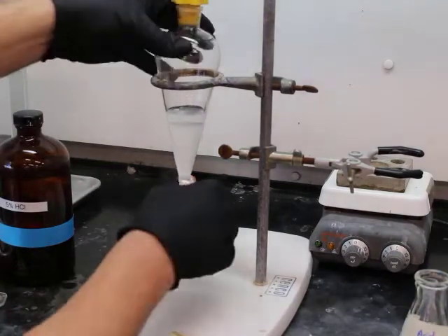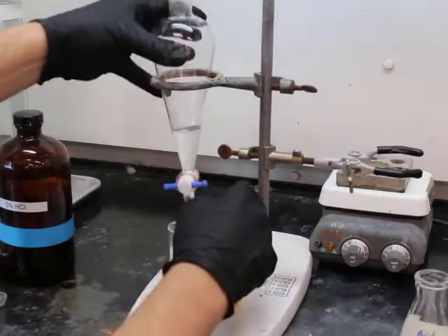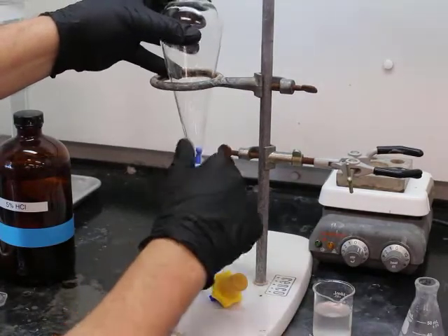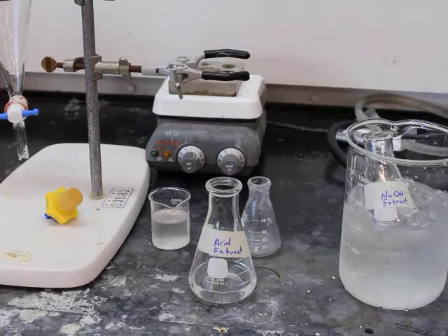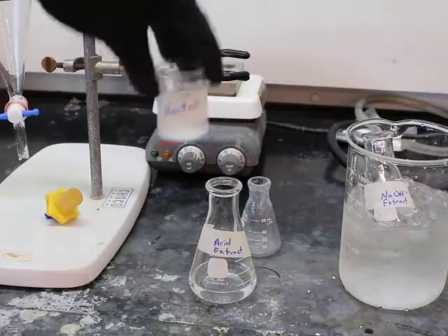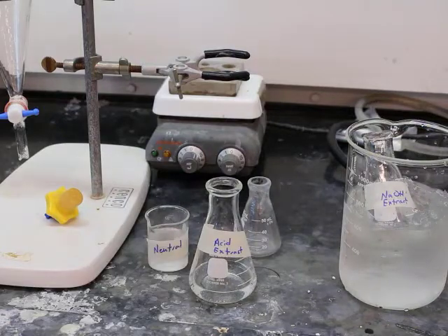Alright, allowing it to settle so that we can remove that top, and there's our aqueous layer. So we have an acid extract in the middle, our basic extract is chilling, and now our neutral, which was the organic. So remember now, we do have 3 extracts here, but now only 2 of them will contain something. One of them should have nothing in it.